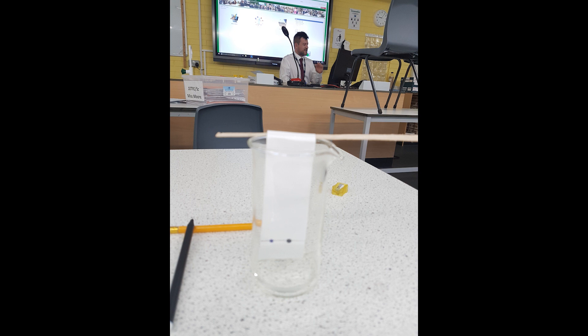And remember, your water level should not touch the ink at any point and it should be below the line that you drew in pencil. Now I've used a splint to hold my chromatography paper in place. The way I did that was I basically just folded the chromatography paper over the splint and that will hold it in place. Now once you place it in, you need to remember: place it in straight and do not move the beaker.